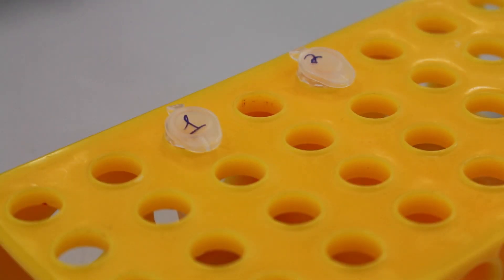Make sure to label the tubes properly. The mini prep is complete and the desired DNA plasmid has been purified. DNA can be stored in the freezer at minus 80 degrees Celsius.